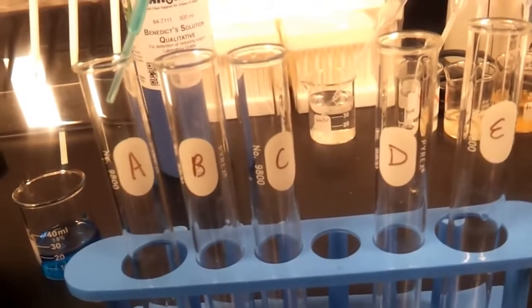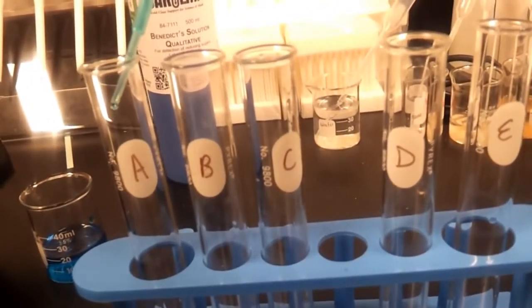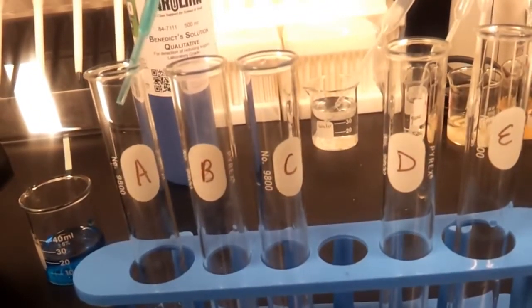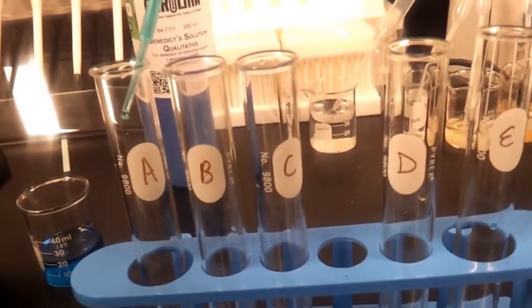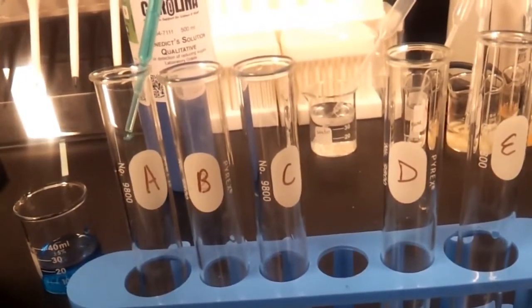Counting drops 1 through 20 into the first test tube.